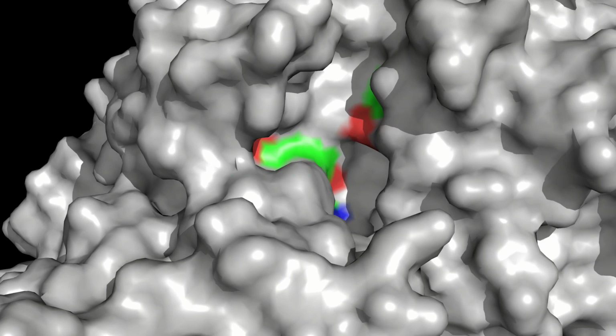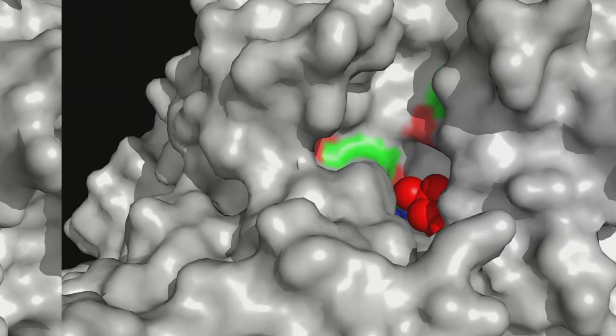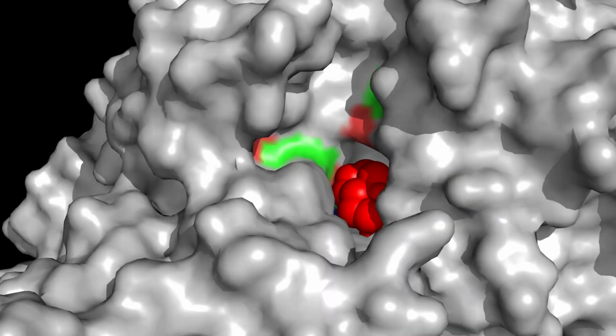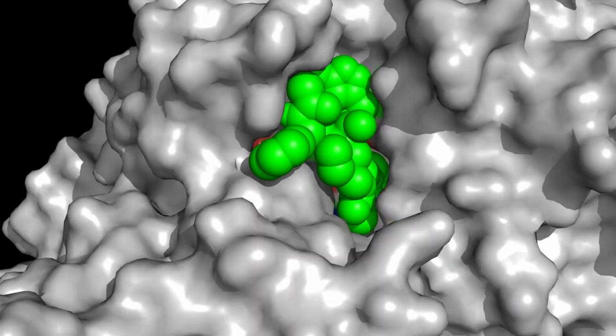We then look through a variety of molecules, one after the other, most of which are poor fits and have low calculated binding energies. But every once in a while, you find the one, that molecule that fills the enzyme active site completely and is a good candidate for looking at more carefully in the laboratory.